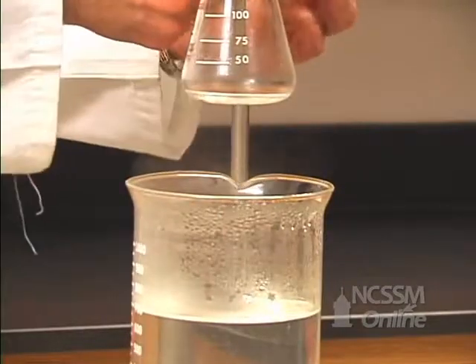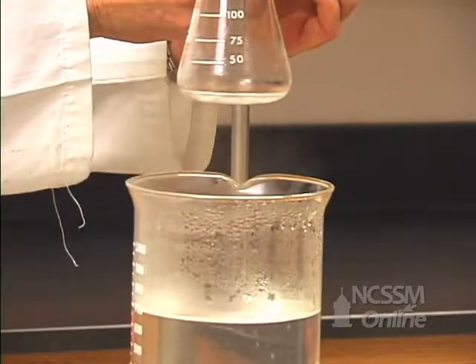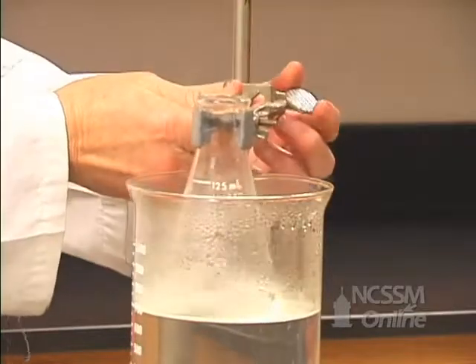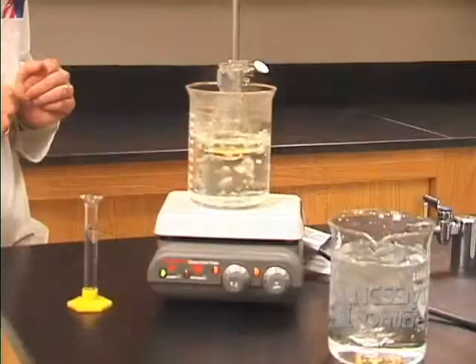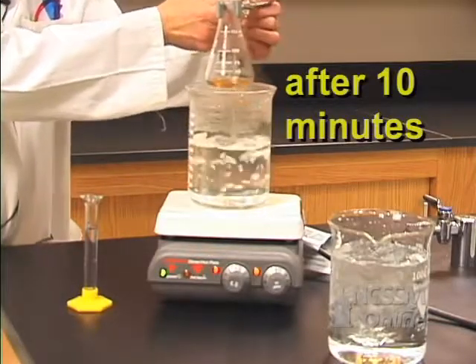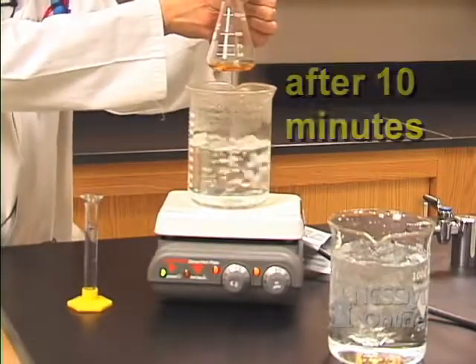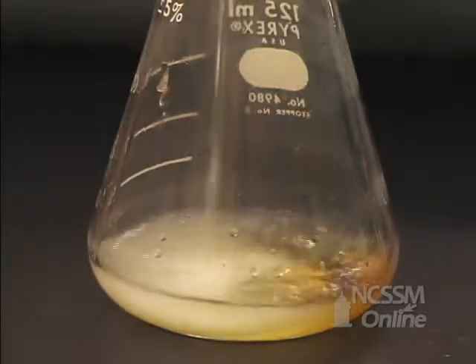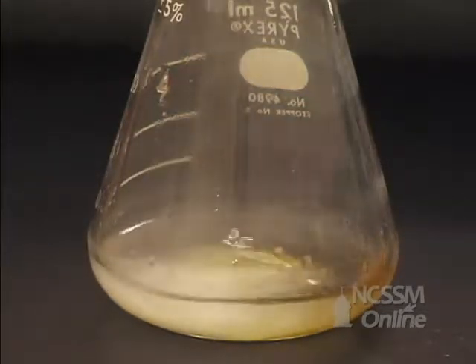We want to heat this in a boiling hot water bath for about 10 minutes. After 10 minutes, you can see that the color has a sort of yellowish brown tint to it. Now we're going to add 10 milliliters of cold water.